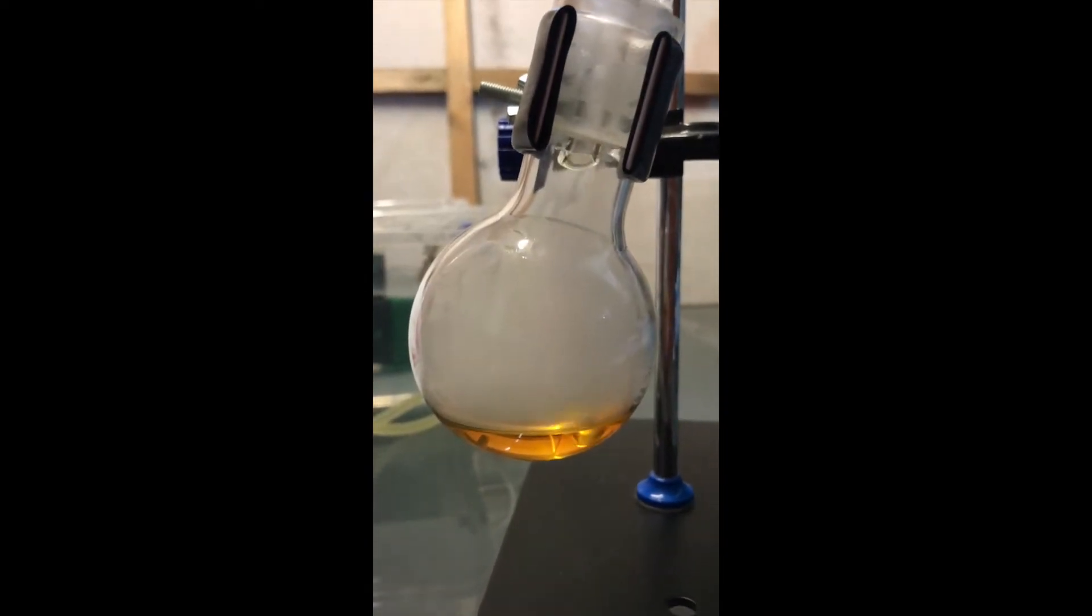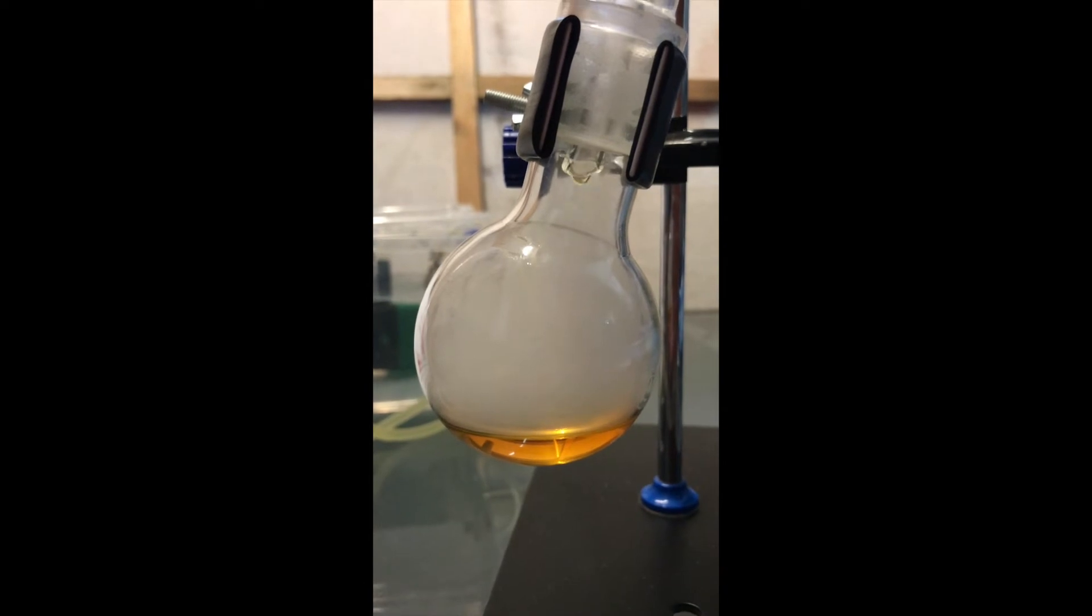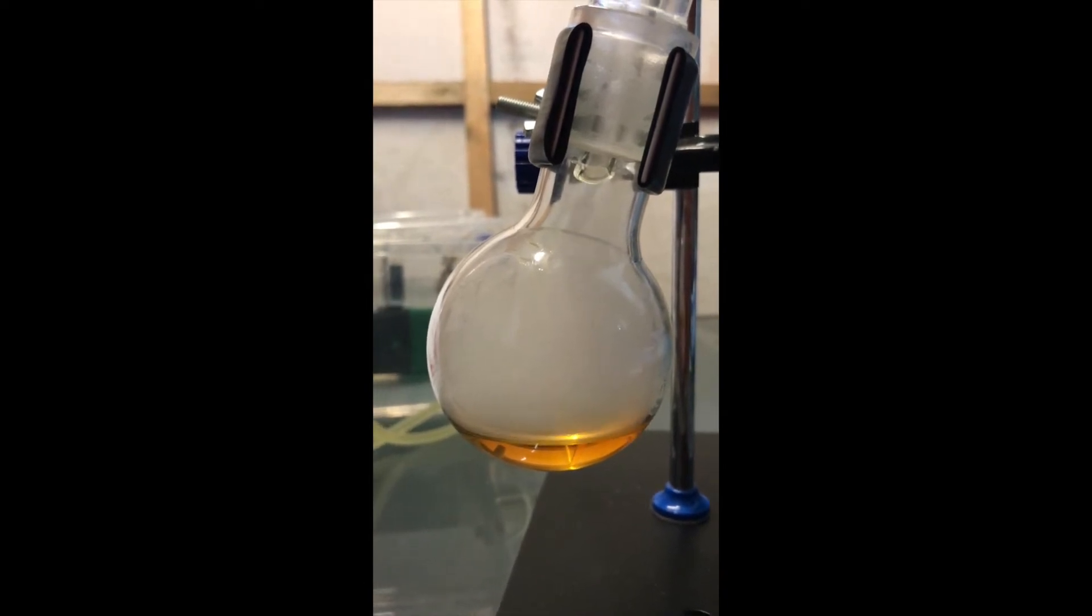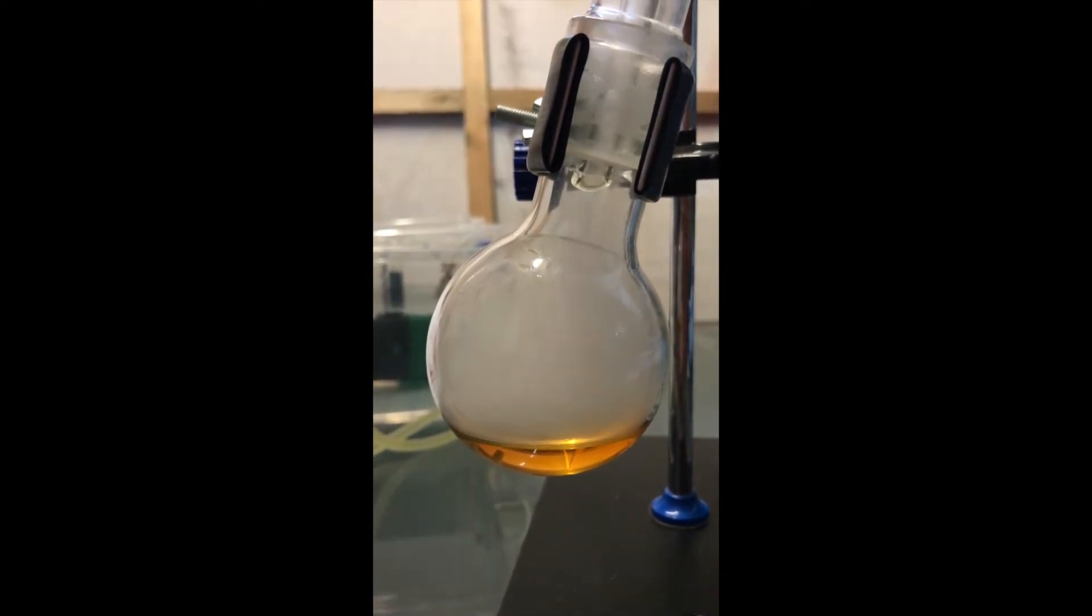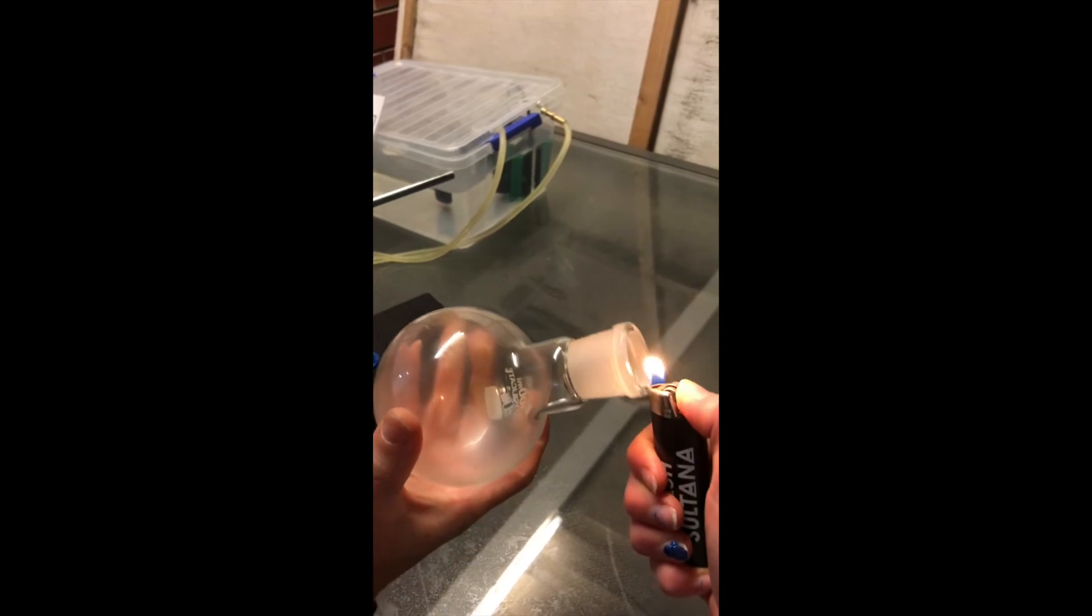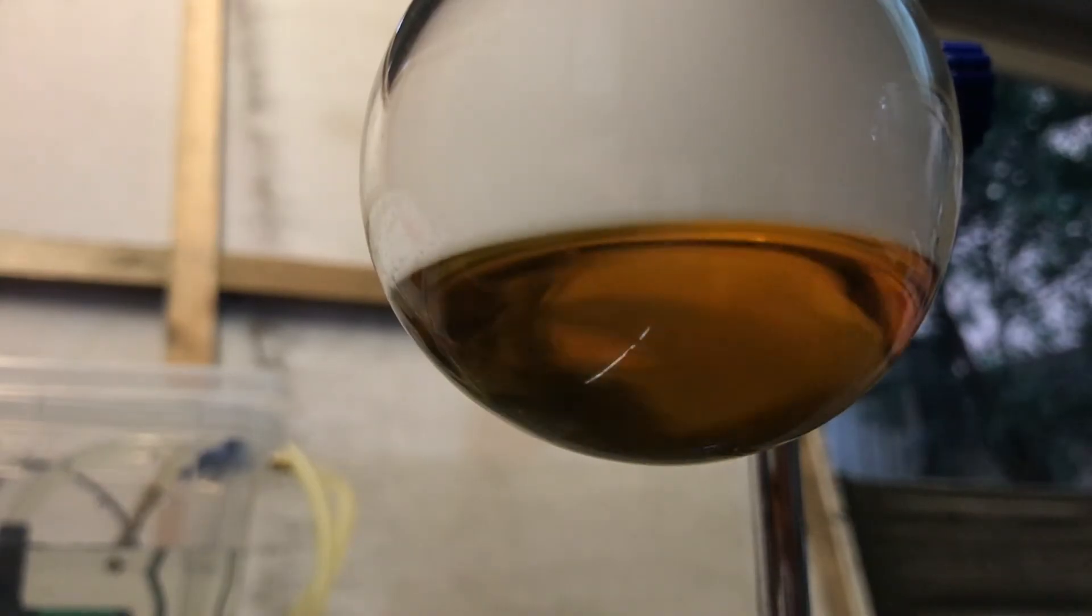Despite being in fast forward, towards the end of the experiment, the drops did start to slow down and then eventually stopped. The white smoke that is being produced is highly flammable, as I demonstrate, by using a flask to capture it and then ignite it with a lighter. This whole process took roughly around an hour, excluding the time in the oven.